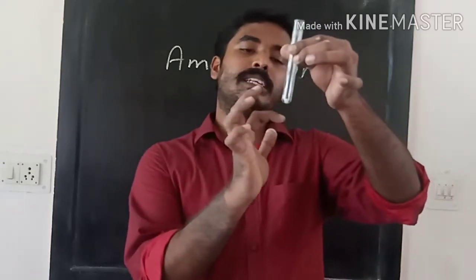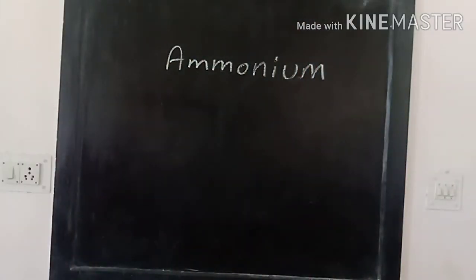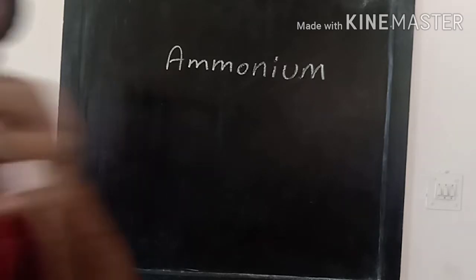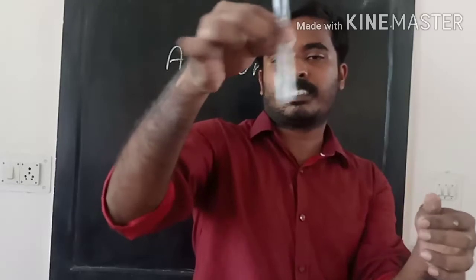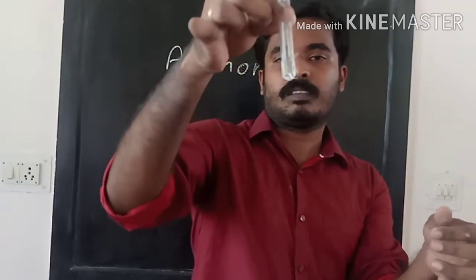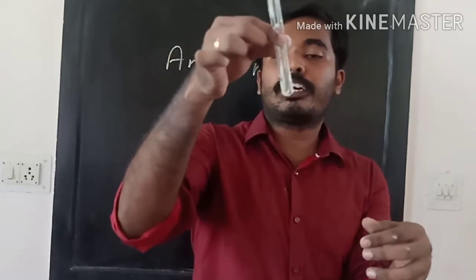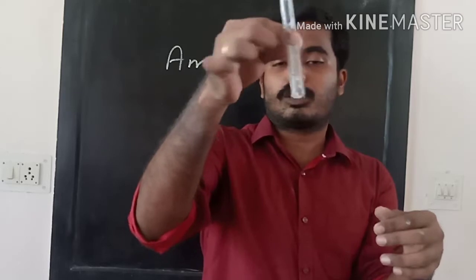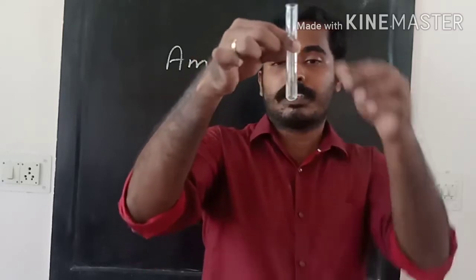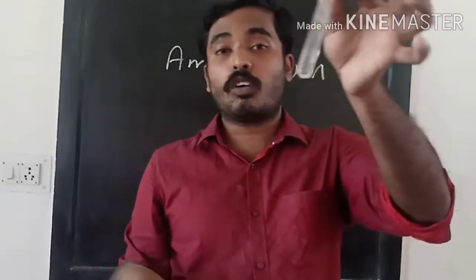First I am going to make a salt solution with it. I am adding water to it. I have added water to it. Now I am dissolving it. Solubility also you should note in your observation sheet. That's also very important for us. Anyway, it has dissolved.